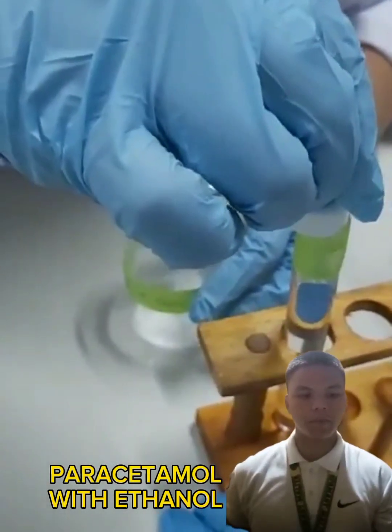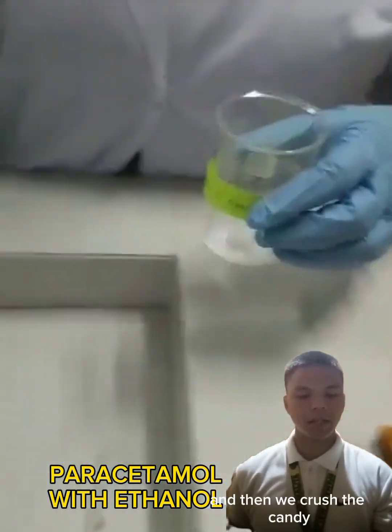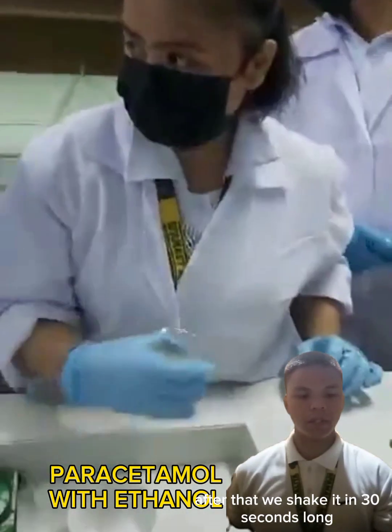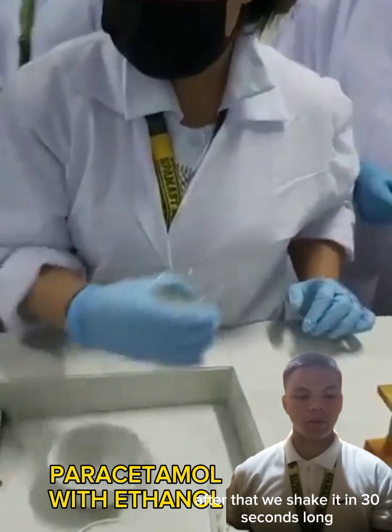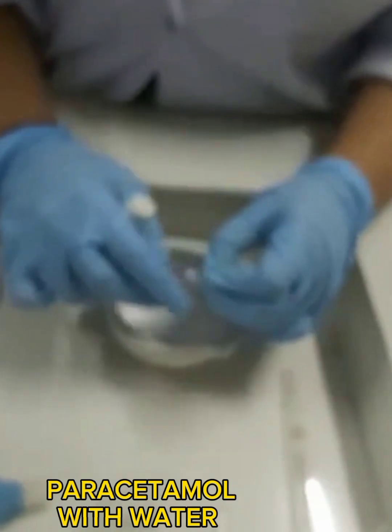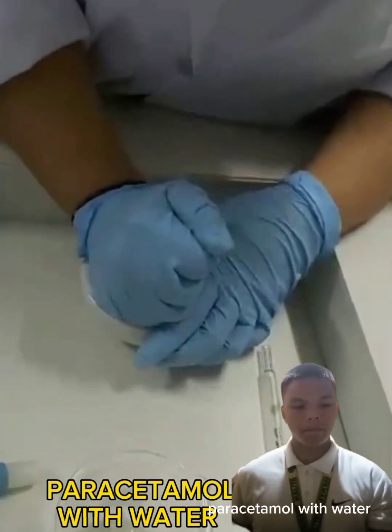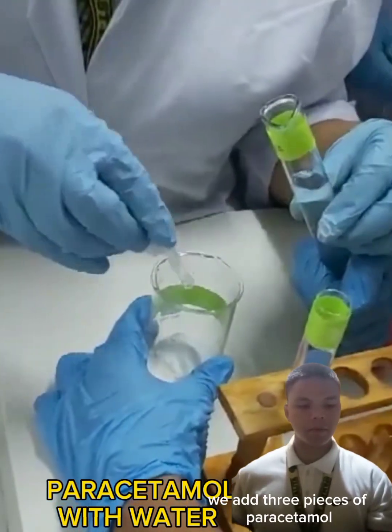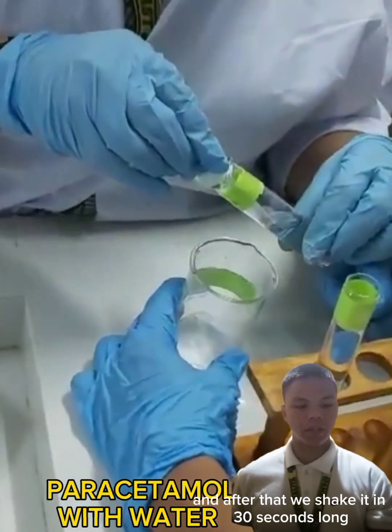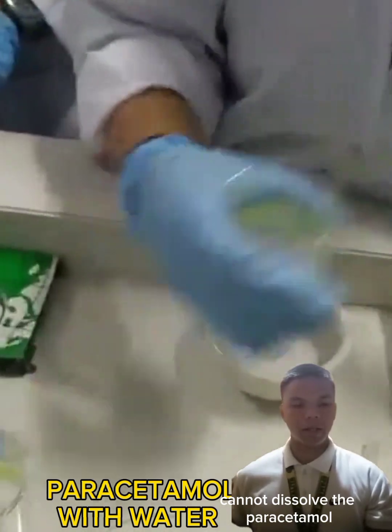Paracetamol with ethanol. We add 3 pieces of paracetamol and then we crush it. After that, we add 3 drops of ethanol. After that, we shake it for 30 seconds. Paracetamol with water. We add 3 pieces of paracetamol. After that, we add 3 drops of water, and we shake it for 30 seconds, and we observe that the water cannot dissolve the paracetamol.